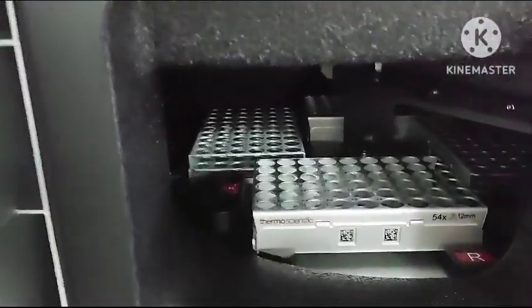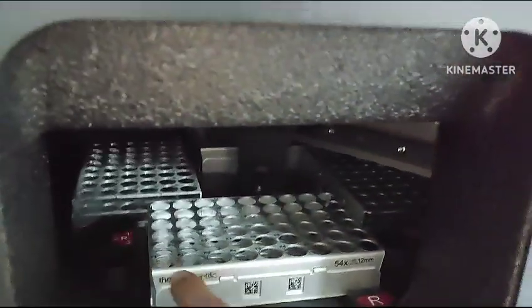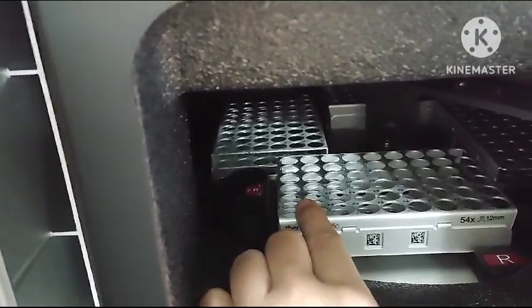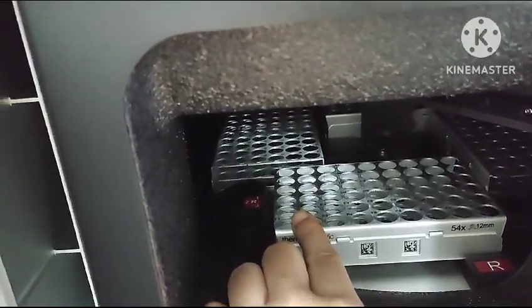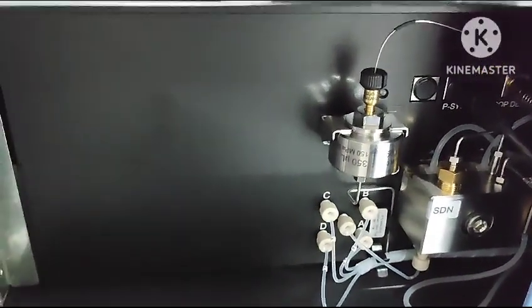This is the sample port which carries these trays of samples, and here we put the sample vial. Inside is the injector which injects this sample. How much injection volume it will take is prescribed or defined in the sequence. That's why we make the sequence, as it shows how much mobile phase, how much injection volume, and how much temperature for the system we have to regulate. And this is the pump which mixes and pumps out our mobile phase into the column.